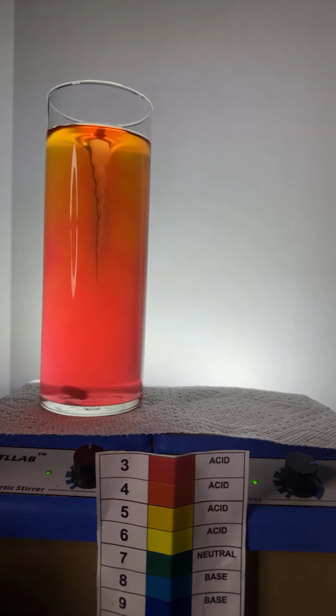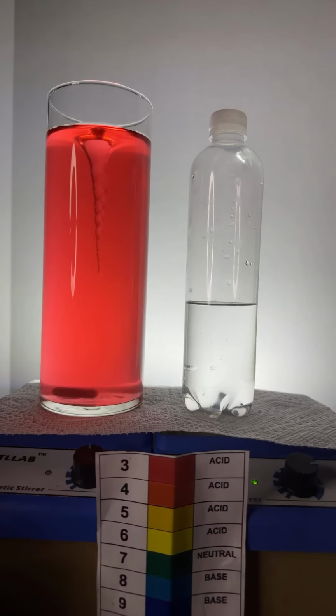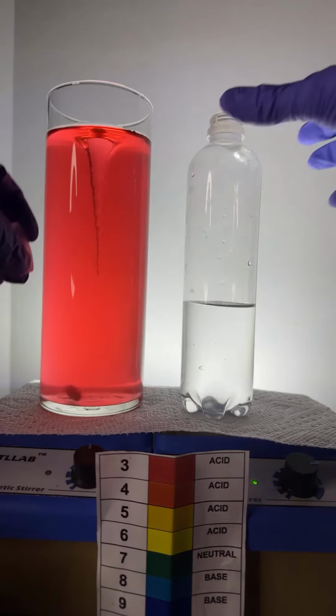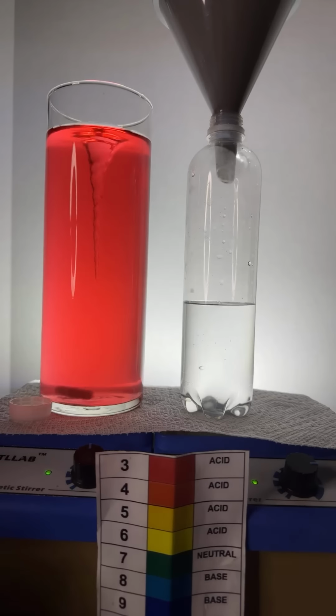We'll take this off over here. We'll get to it. Here we go. I have a bottle here with some water in it. This is going to blow your mind if you haven't seen it before. You're going to love this. So, to this bottle of water, there's just water here. To this bottle of water, I am going to add some acetone. So I'm going to just put a little funnel here up at the top. And we're going to put some acetone in here.